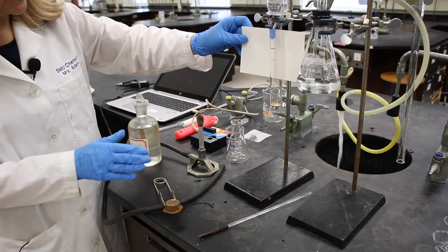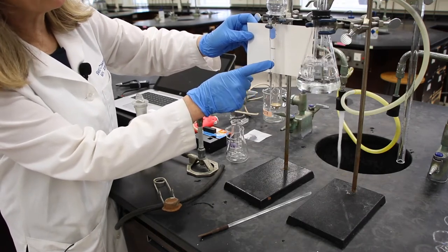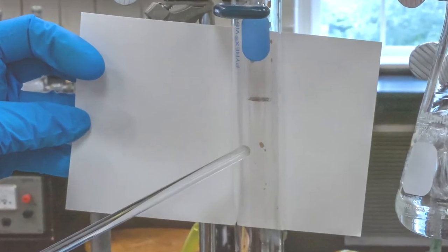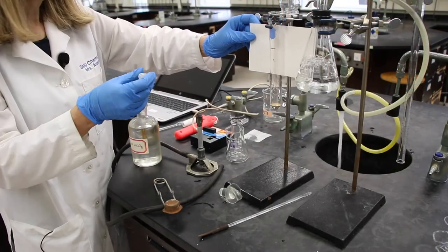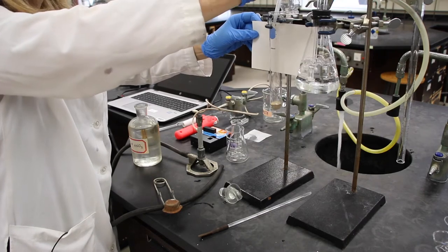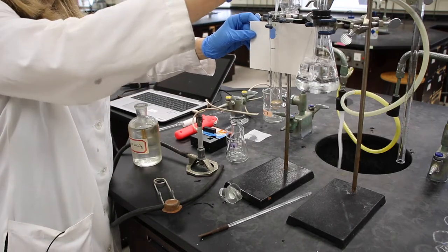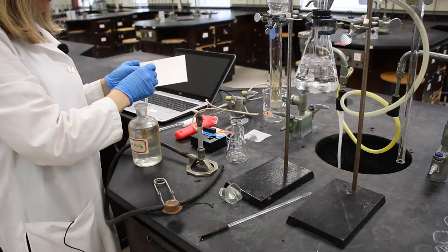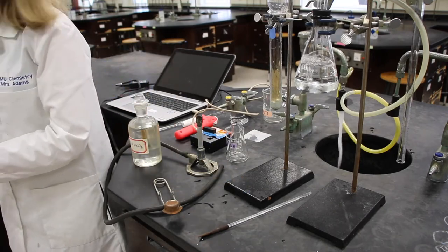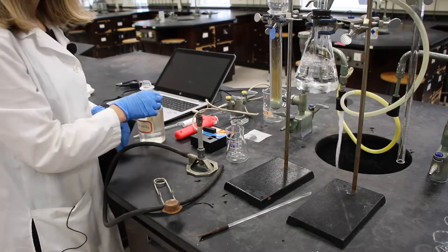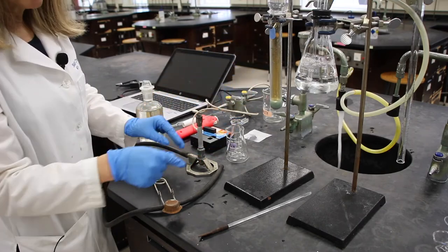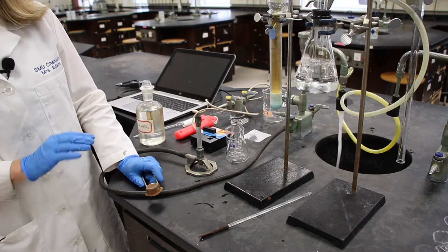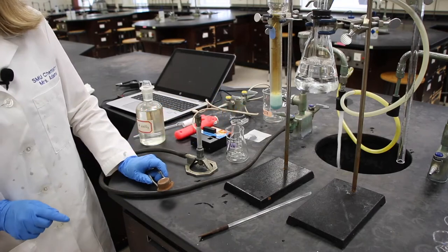In step six, we're going to add two pipettefuls of nitric acid. There is a small bit of the alloy sample. We can kind of target that when we kind of wash it down into the solution. So, I'm just going to kind of get all the sides here. And then quickly put the hood back over the test tube. Already you can see that some of the toxic gases are being generated. Those are the brown NO, NO2s. And right now, I'm not going to even add any heat, because it seems to be dissolving well.